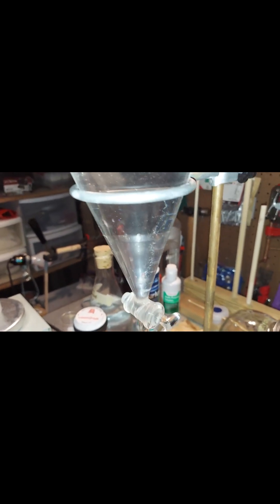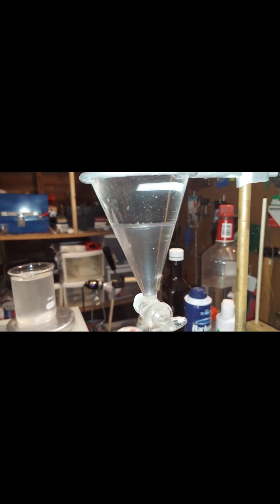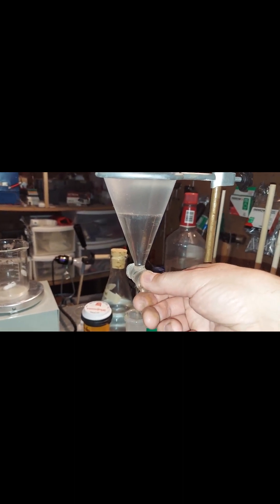Just poured what was in the bleach gallon in here. Everything above that is basically water with salt mixed in it, and down here is the chloroform. We're gonna now empty the chloroform into this round bottom flask.